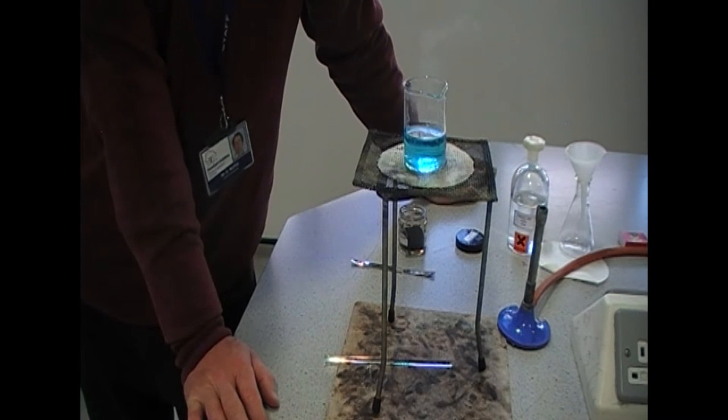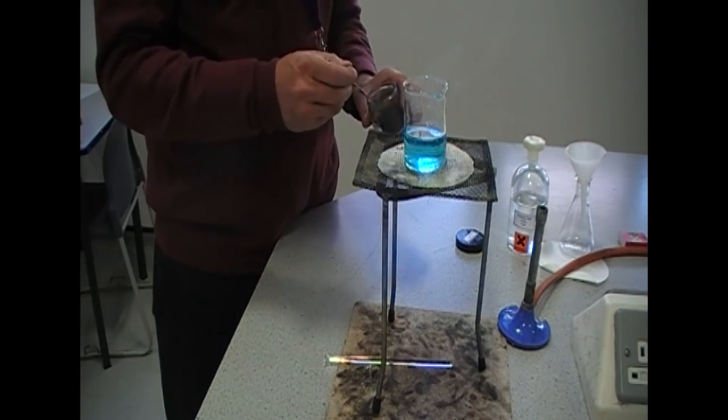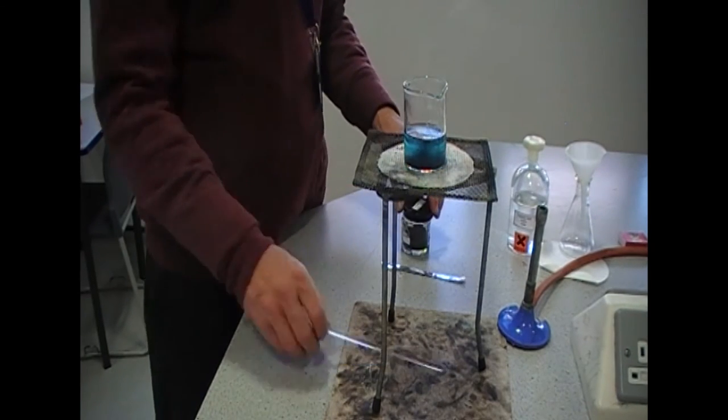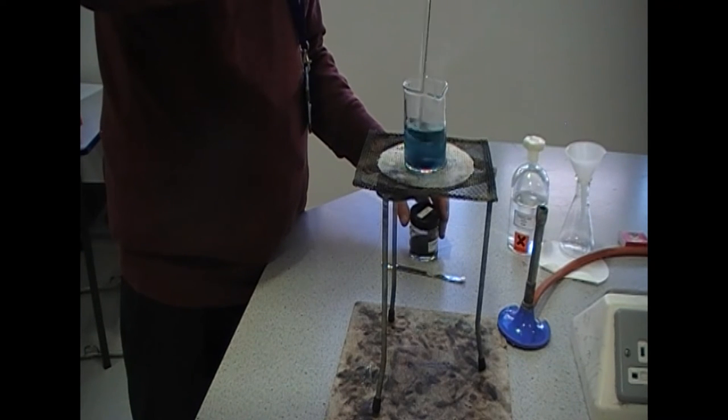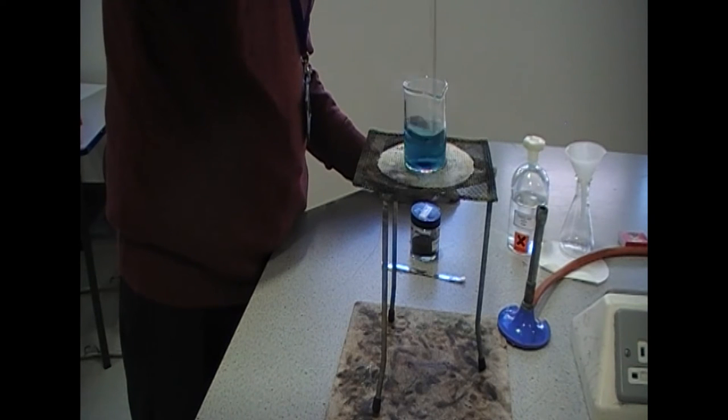We need to continue to add more black powder if the powder disappears. We stop adding when some black powder remains after stirring. So we add a bit more. With a spatula, we stir with a glass rod. And you continue this process.